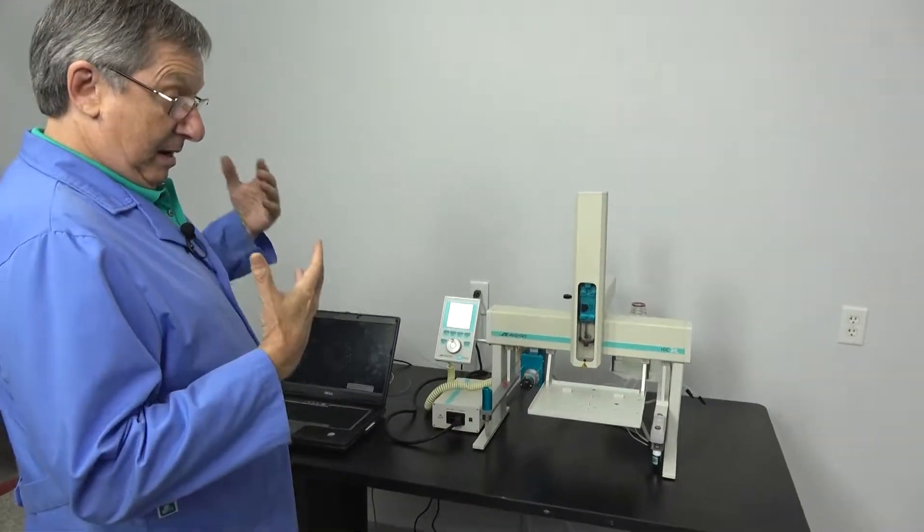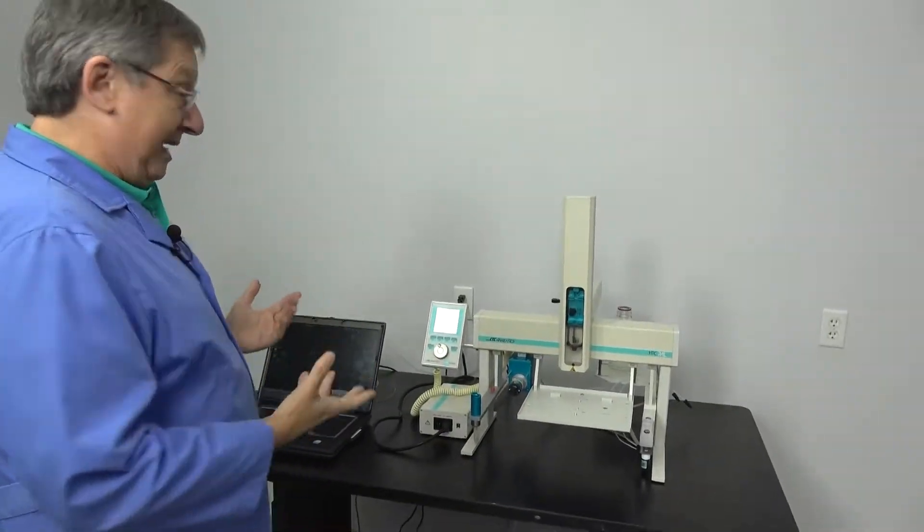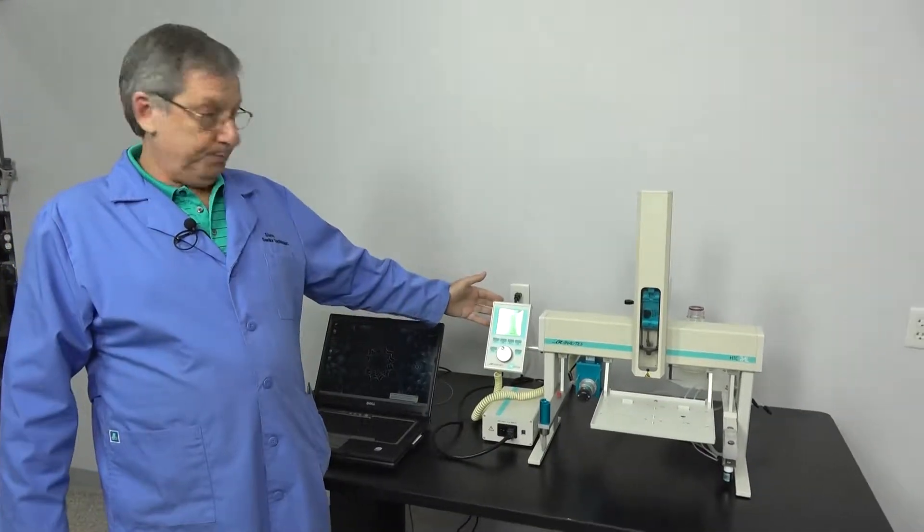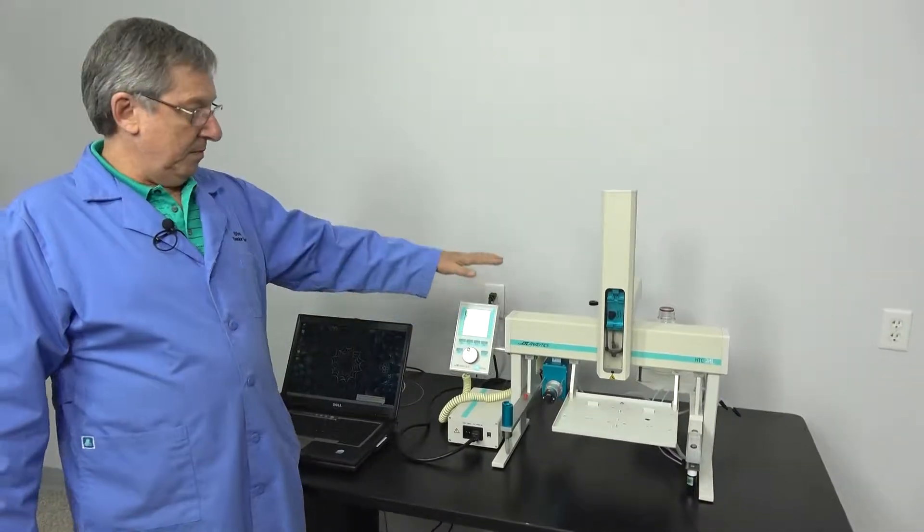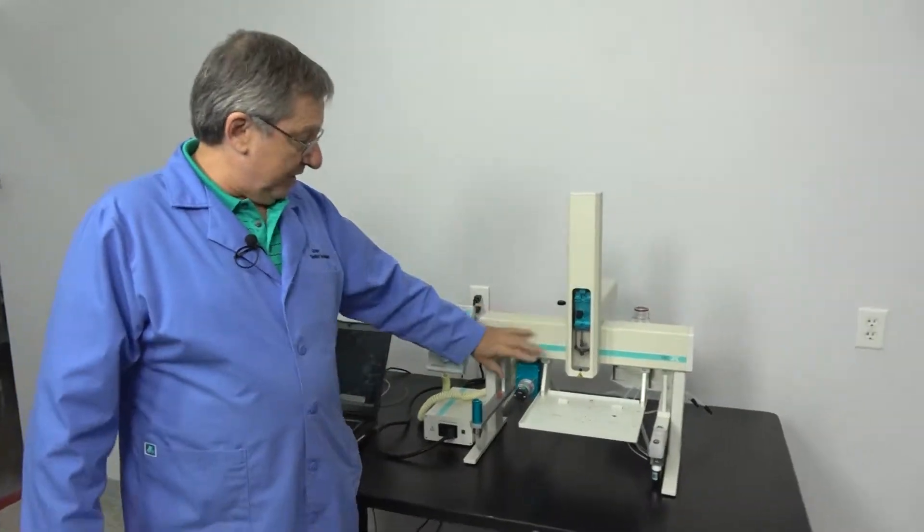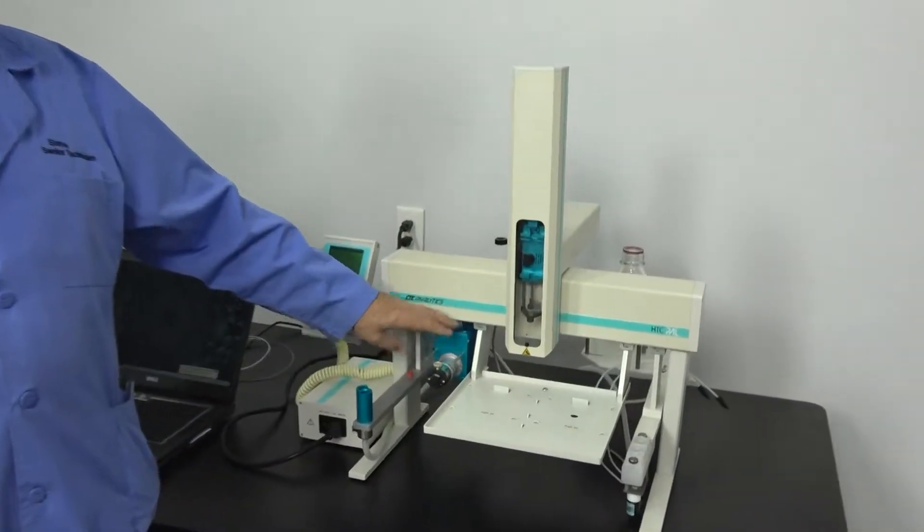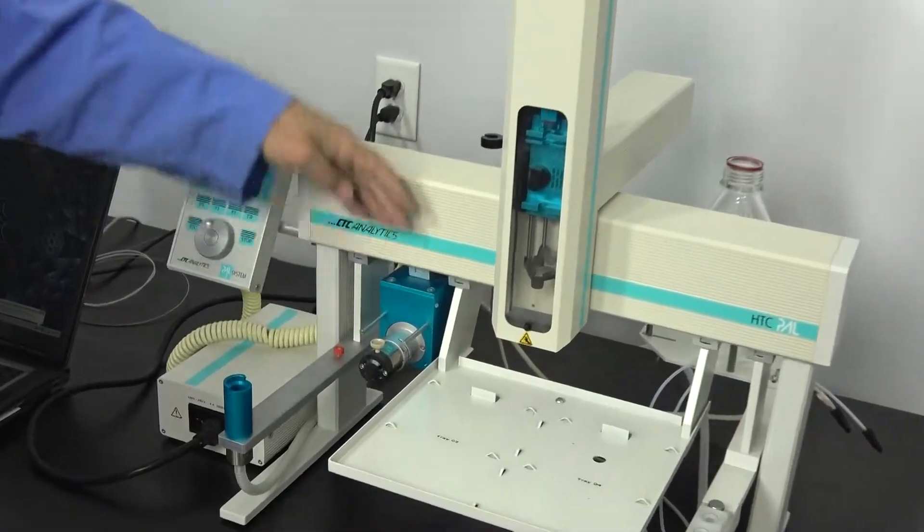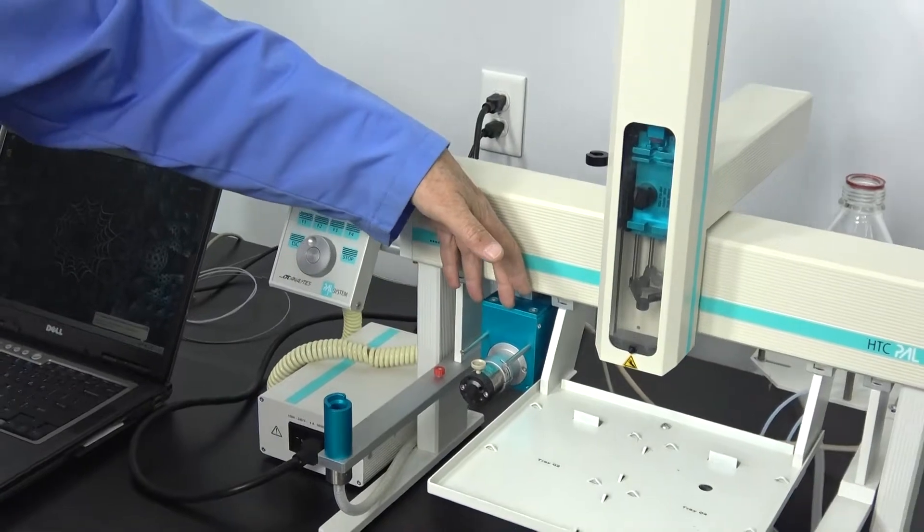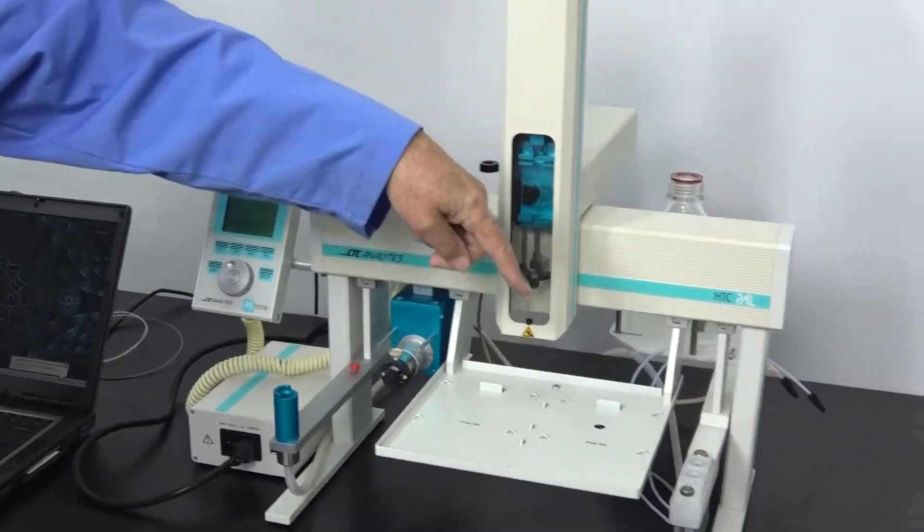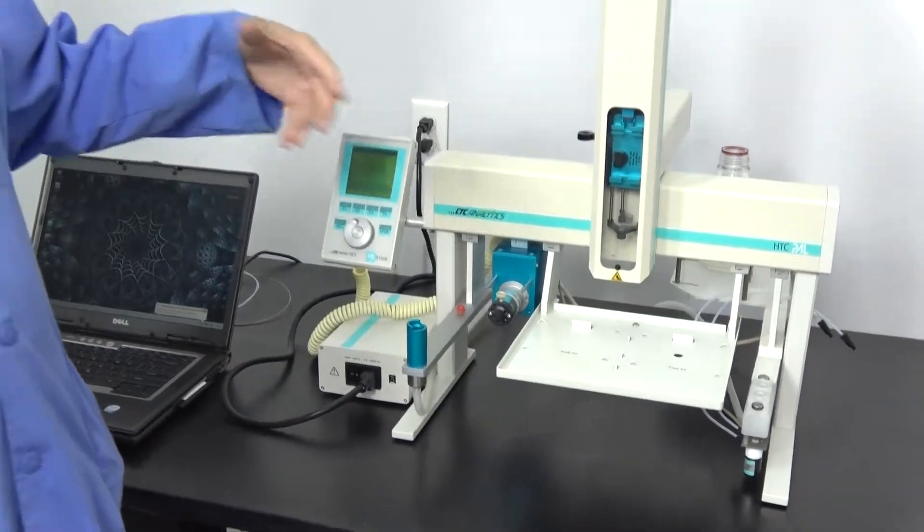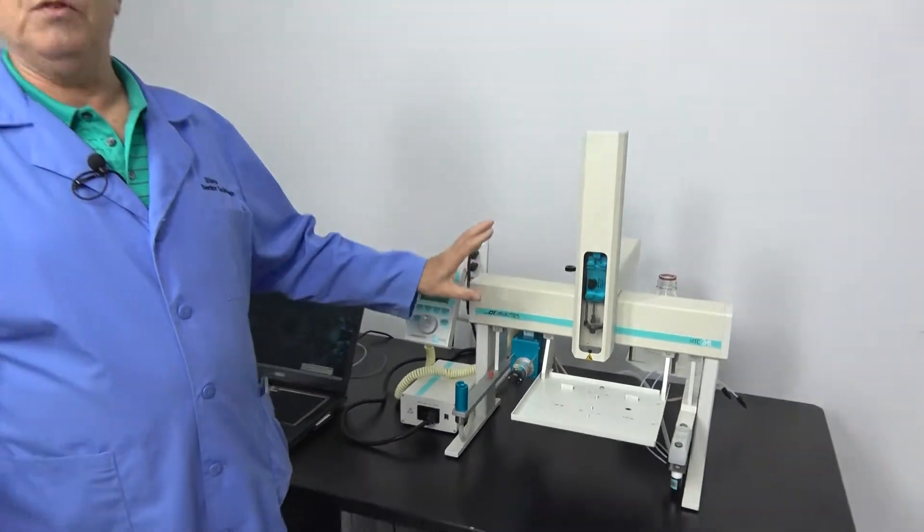Today we're going to talk a little bit about the maintenance of your system, how to upgrade your software, and add objects. What I mean by an object is the injector valve and motor drive is an object. You need to teach the system about this device, just as you do with your washer, your MALDI options, and a host of other options.